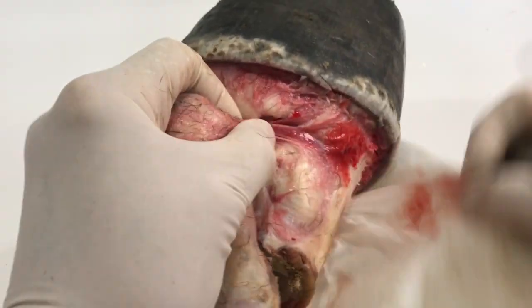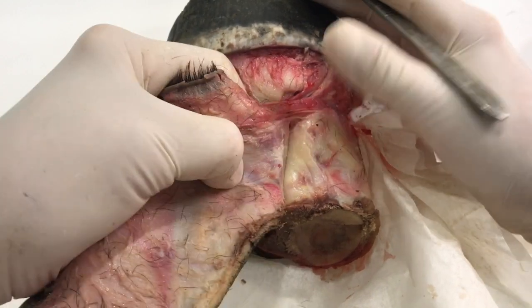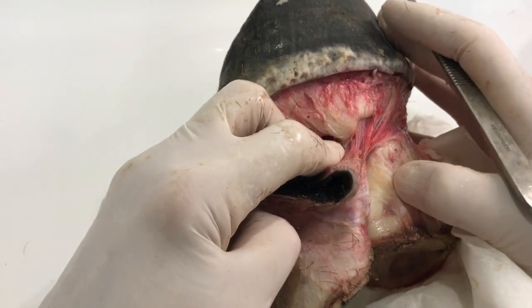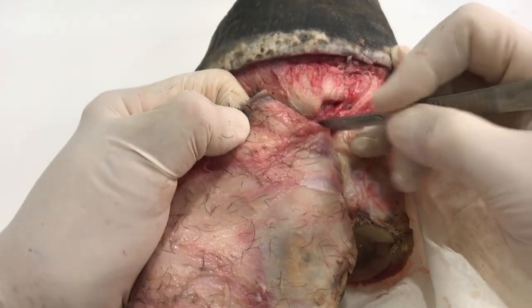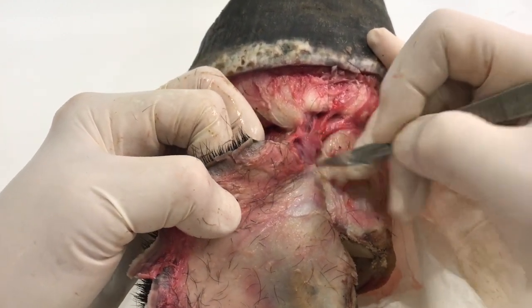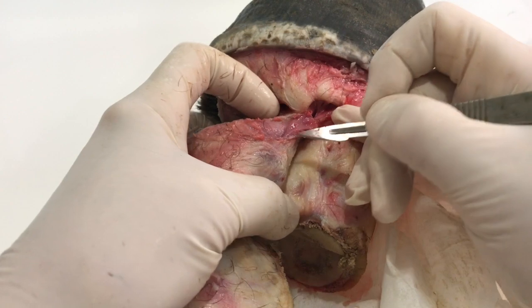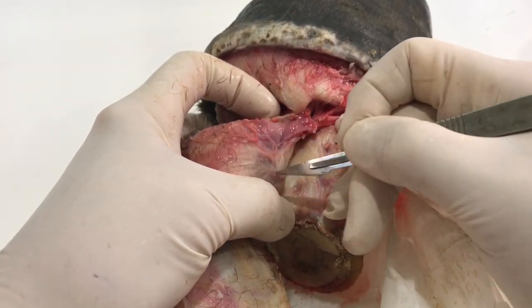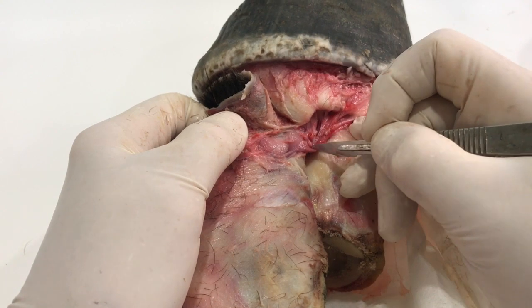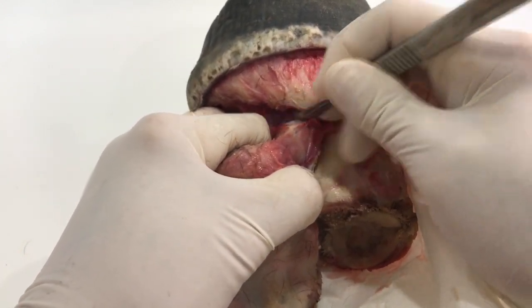I'm going to cut through that blood vessel because I need to get this hide off, but we can look in the textbooks later to identify what vessel it is. It's so incredibly close to the external hoof wall. I'm starting to dissect a little bit more through here. It's a big blood vessel and you can see why horses bleed like crazy when they get a cut in this area - that's quite big. Let's just cut through this because we don't want to hold this up any longer.